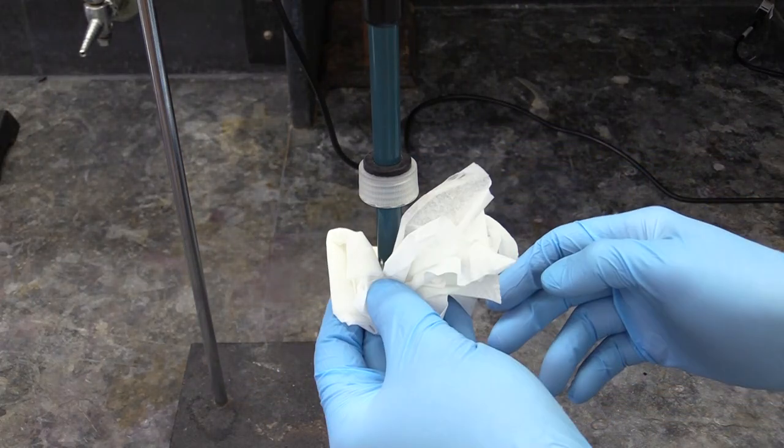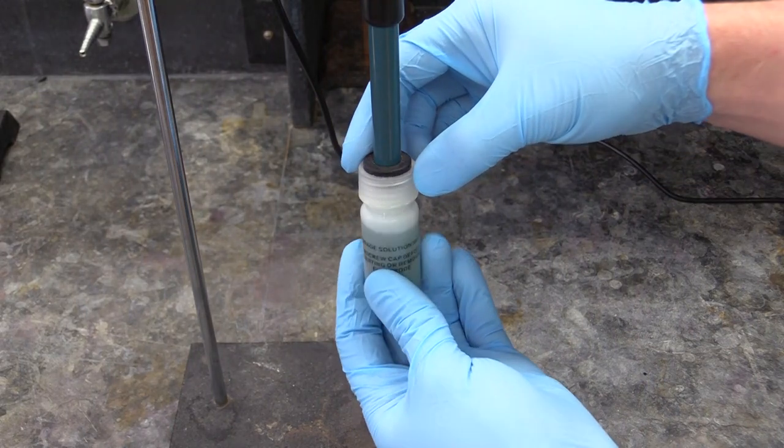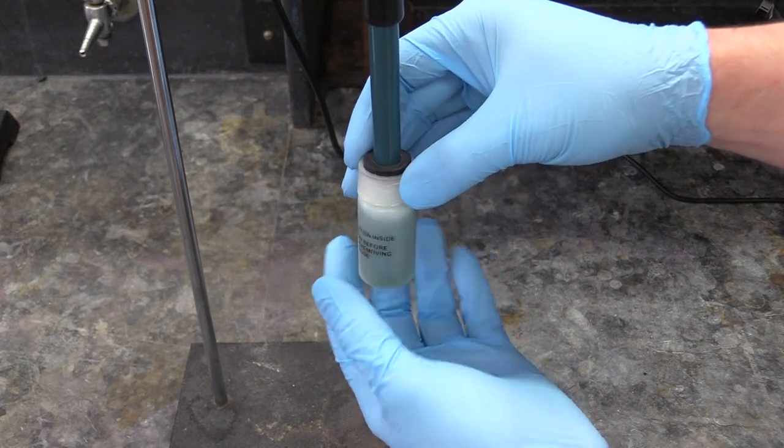Also, if you're not going to put it into a solution right after calibrating it, screw its storage bottle back in place so it won't dry off.